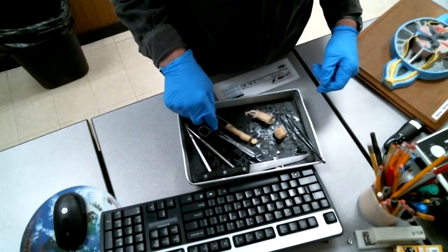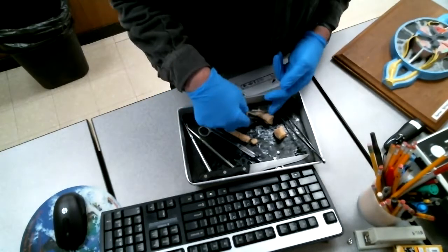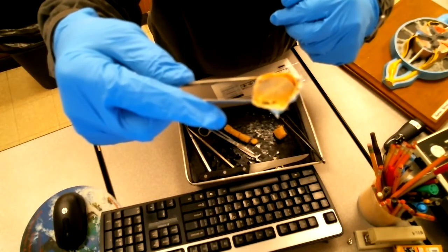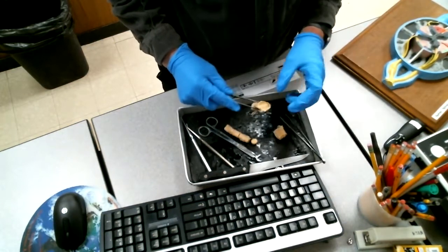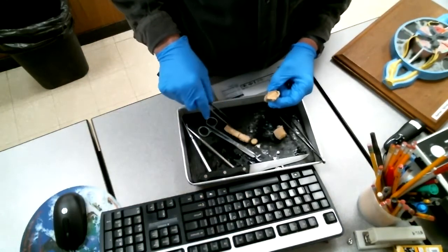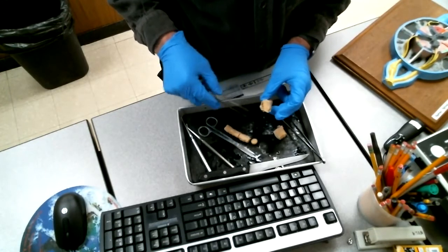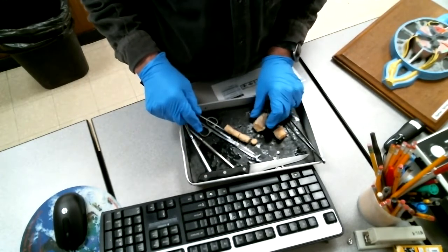This area here, I've actually already made a cut. That's probably an area that's more posterior. This area right here, you can kind of see there's the gray matter there and the white matter surrounding it. This is a more anterior region, closer towards the head. So the spinal cord is larger in diameter, and it still has the meninges attached, whereas this one doesn't. You can see the nerve roots coming out, and you can see some of the space inside there that would be filled with cerebrospinal fluid.